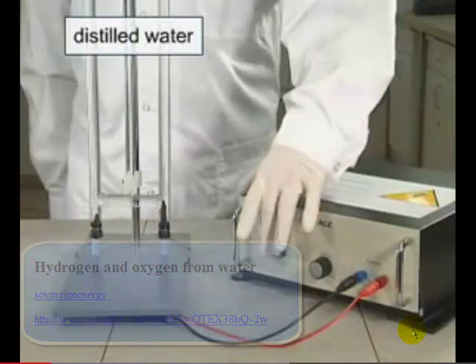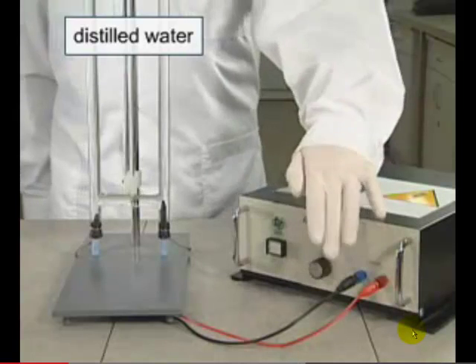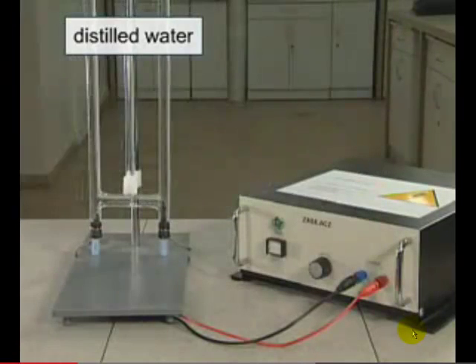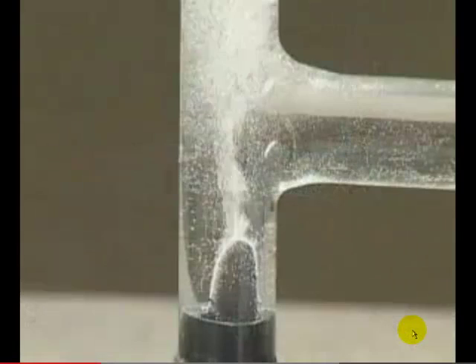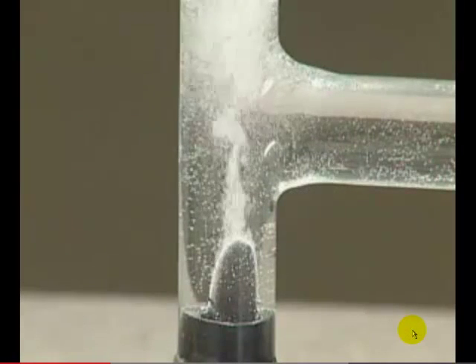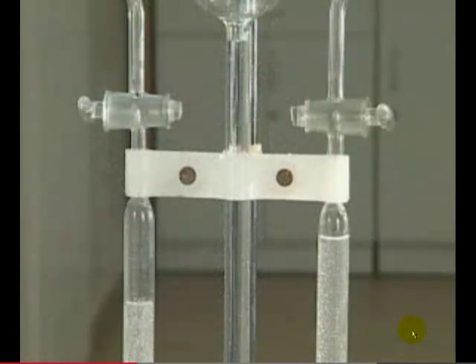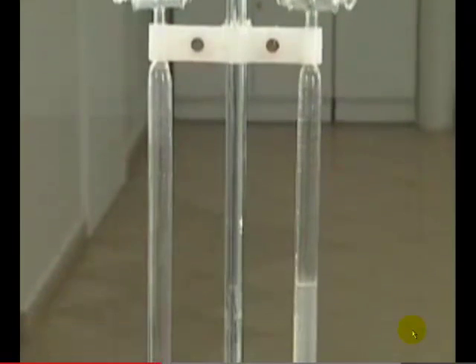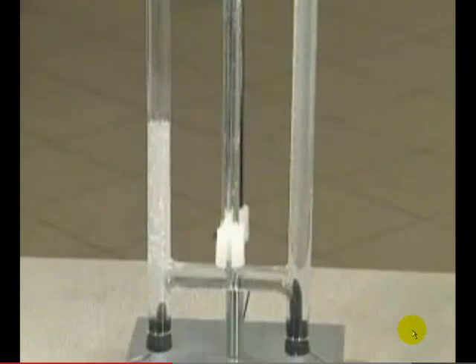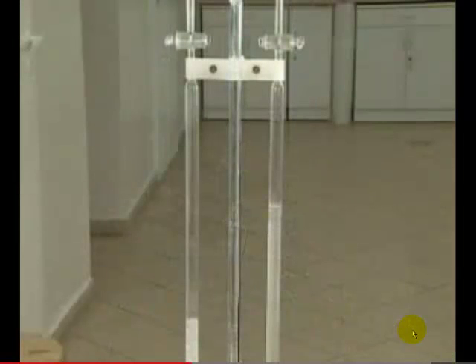If we connect an electrolyzer filled with distilled water to a source of direct current, we can observe a slow evolution of gases. After some time, we notice that the volume of gas released at the cathode is double that of the gas formed at the anode.